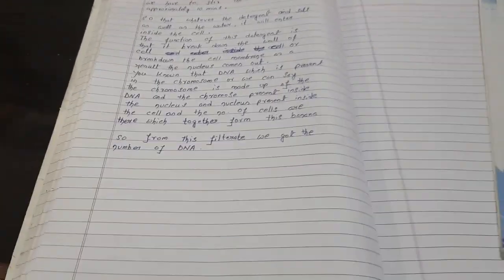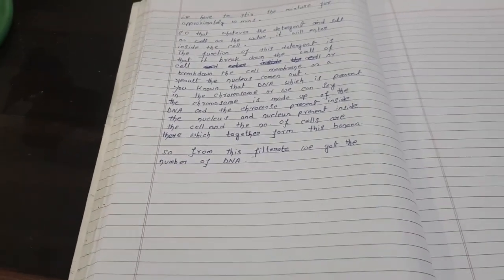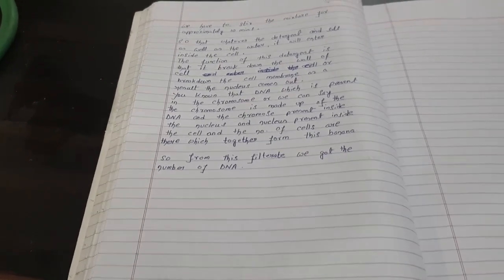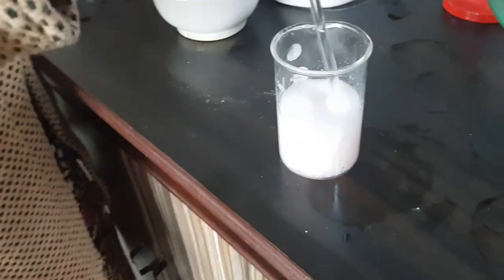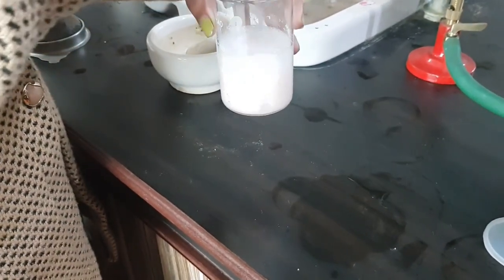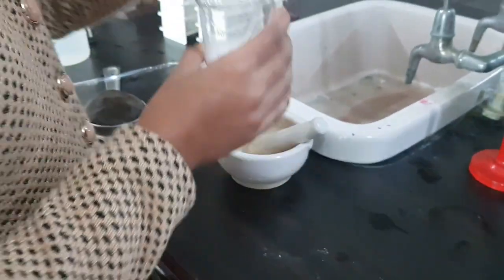After 10 to 15 minutes of stirring, from this filtrate we can get the DNA. Next we have to filter it and then add ethanol. After adding ethanol to the filtrate, we have to again wait for 10 to 15 minutes so that we can see the DNA isolate on top of the alcohol in a test tube. For about 13 minutes we have done the stirring process so that the cells break down and the nucleus — and therefore DNA — can come out. Now we have to filter it.